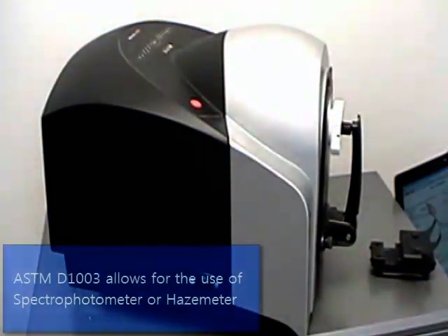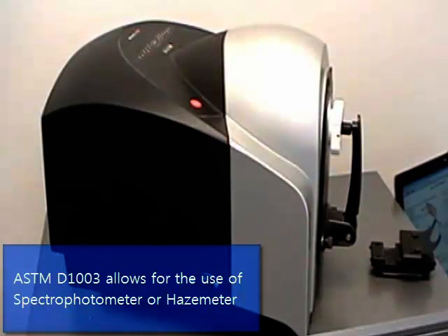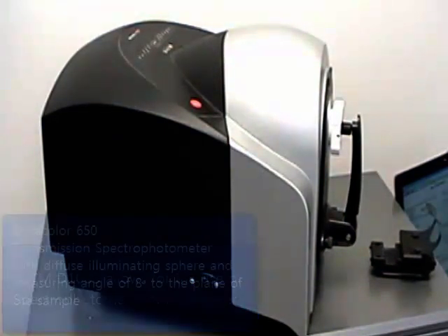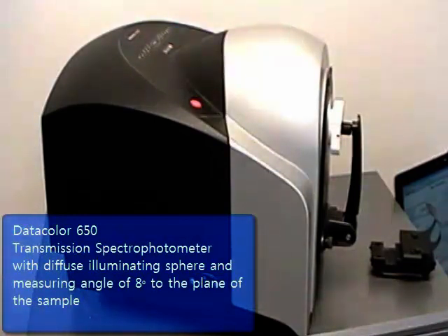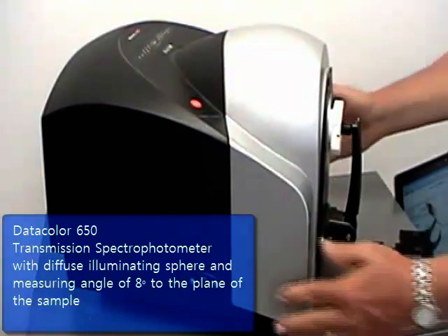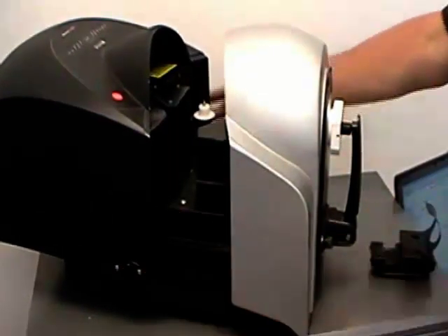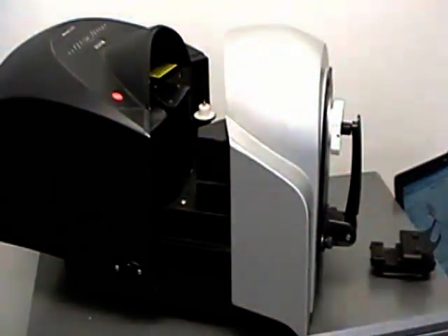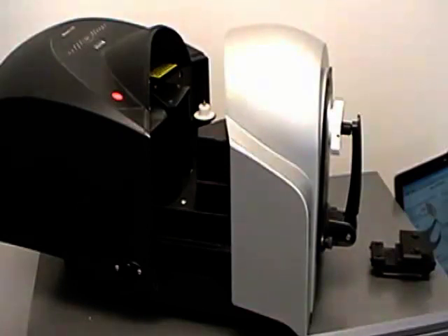ASTM D1003 allows for the use of a spectrophotometer or a device called a haze meter. This video uses a transmission-capable spectrophotometer with a diffuse illuminating sphere and a measuring angle of 8 degrees to the plane of the sample being measured. This spectro conforms to ASTM standards. Not all spectros do.